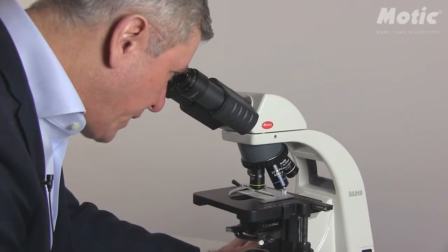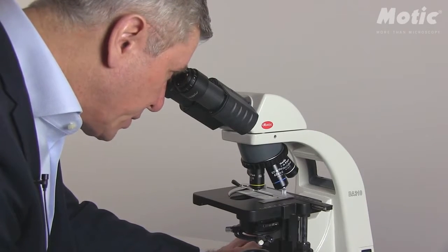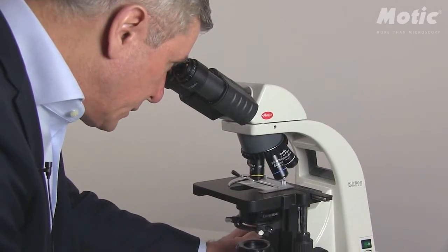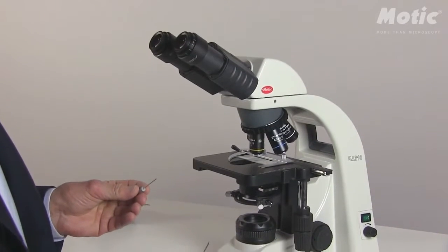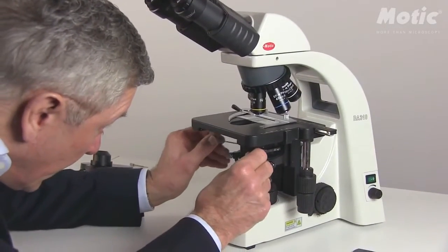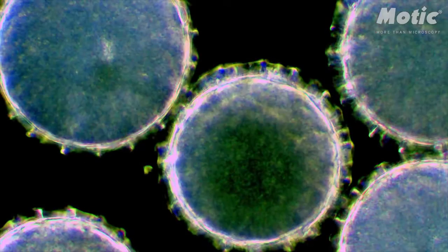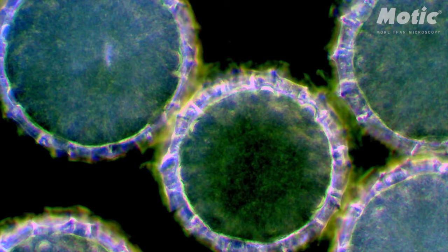Once you have achieved a maximum darkness of the background, please have a closer look at those tiny little structures that you would like to observe, and have a look at the surroundings of those structures. The surroundings should be of homogeneous brightness. If not, please take these Allen keys, which are an integral part of the darkfield package, push them into the slider and move the central stop up to the point where the border of those cells or cilia or whatever is homogeneously illuminated. Then take away the Allen keys.